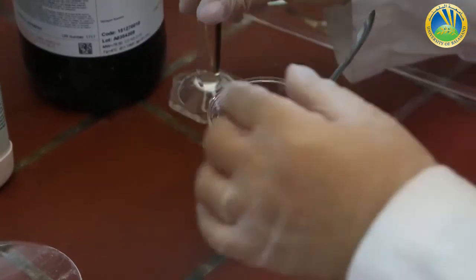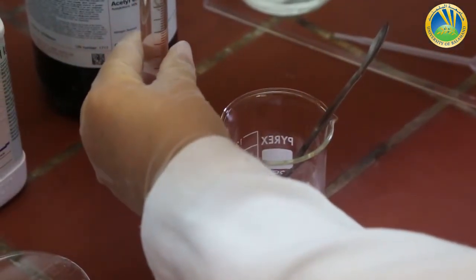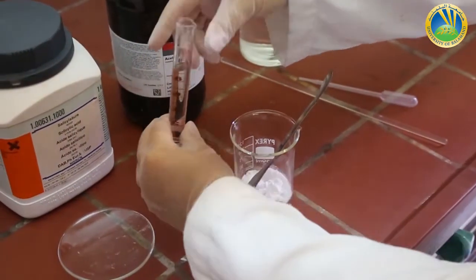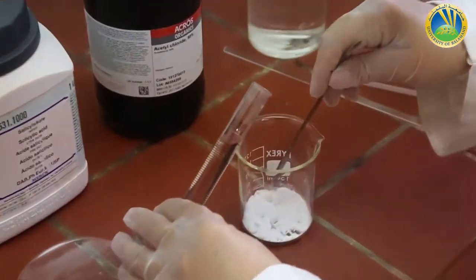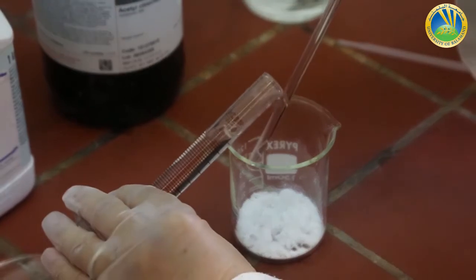I will introduce the 9 ml of acetyl chloride. I covered it in order not to lose any amount by vapors. I have to stir it now with a glass rod.